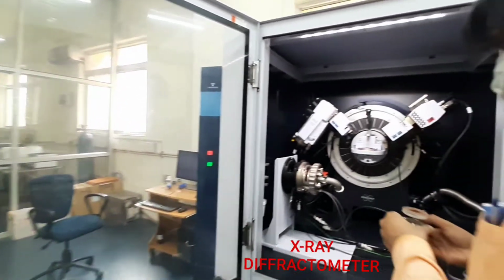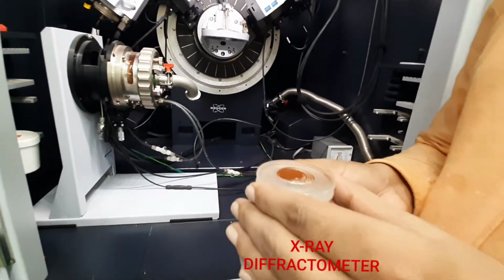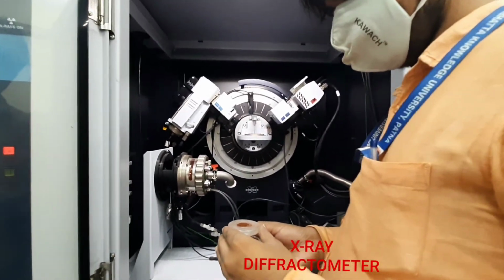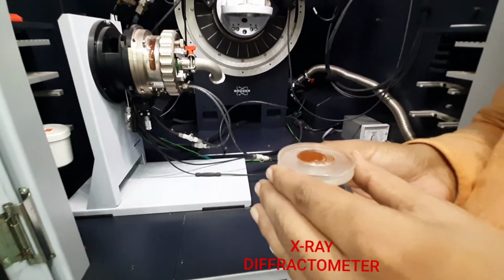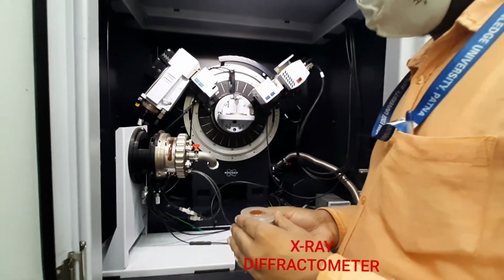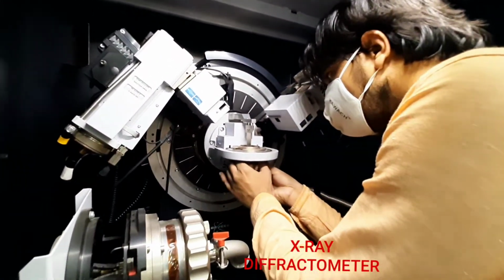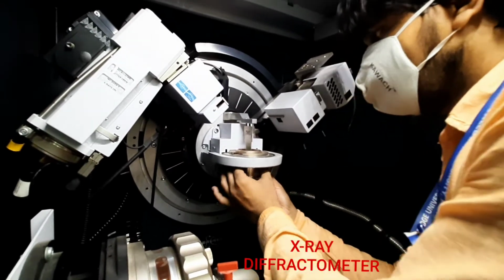To start, let me show how you prepare this. This is a sample from one of my colleagues. Magnetic materials are used in various areas of the electronic industries, medicine, and agriculture. Now, how do you put the sample for characterization? This is the sample. You can see the sample is being placed in a sample holder.